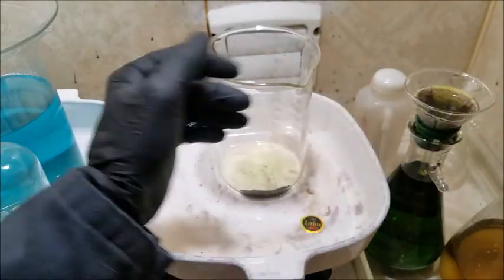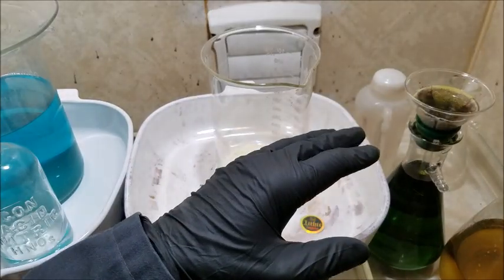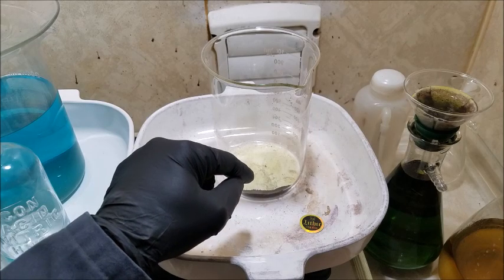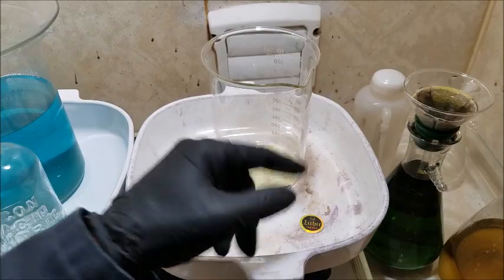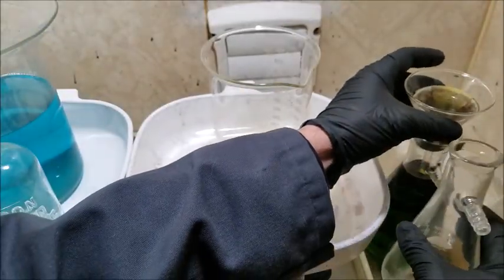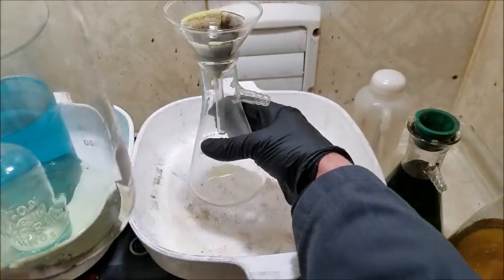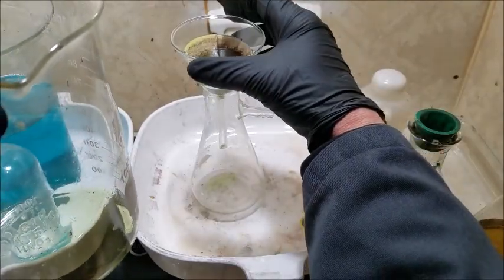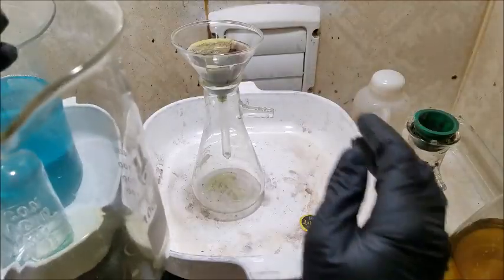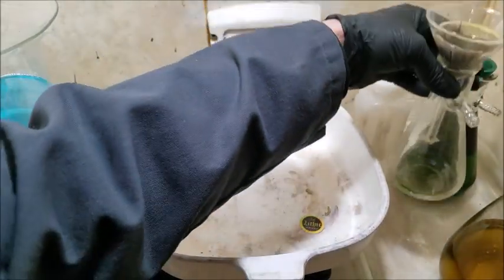I'm going to let this filter through. I'll finish with this bit that's left in the beaker. We'll rinse it out good, throw it right back in the beaker, and look what I'm doing here. Jumping the gun, that's what I was doing. First thing I was going to do was switch this around. This is right to the top. I'm glad I noticed. Alright. Just gonna set this back down here.